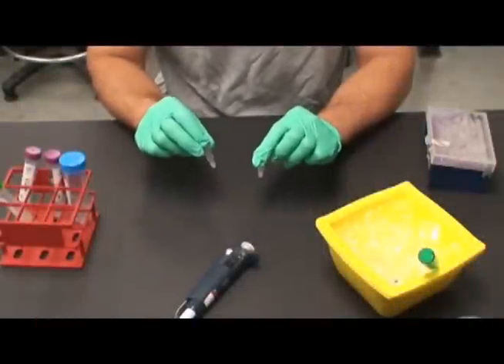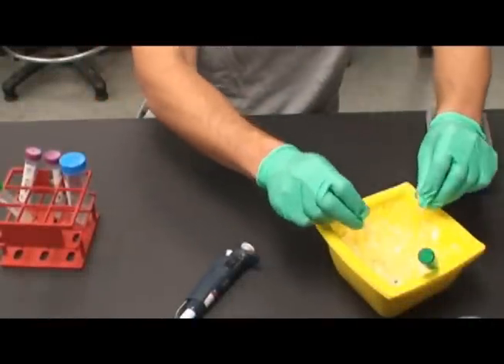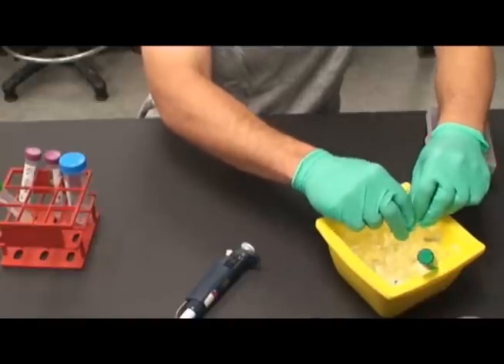Over time, at least 30 minutes, these cells will become competent and for the rest of the lab, these are the competent cells. Take care to remember this.